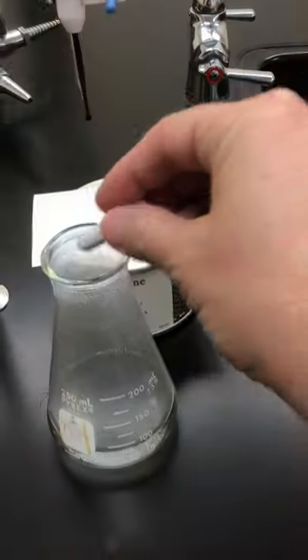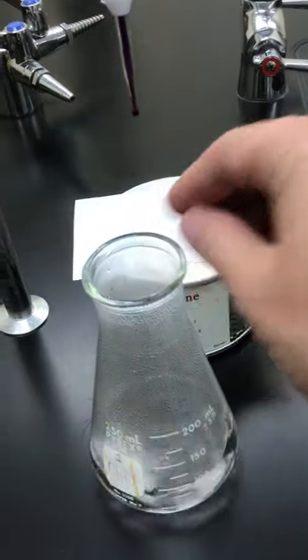I'm going to put this flask underneath our burette. We're going to add that magnetic stirrer to the bottom, and then I'm just going to get my camera set up here so you guys can see.